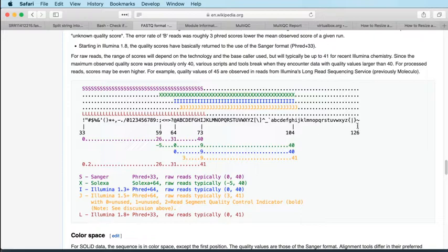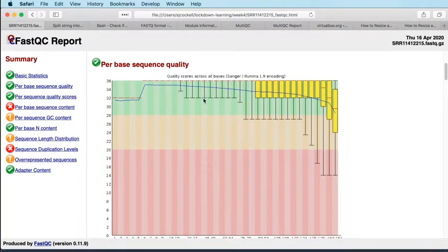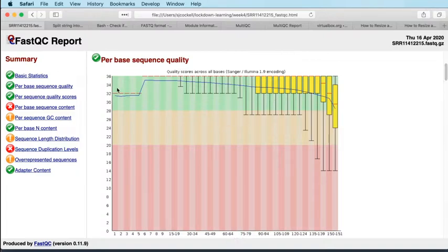And so to go back to our FastQC report, here we are. What this is telling us about the quality here is that, generally speaking, the quality of our sequencing is very high. And you can also see in this box plot the effect of the binning, because base quality scores can only take certain values. These box plots are very discrete.